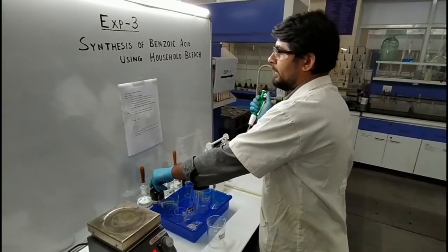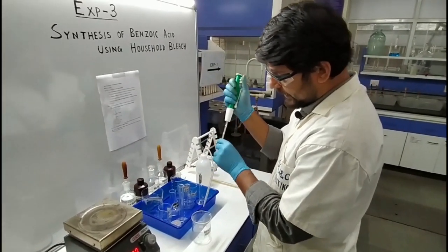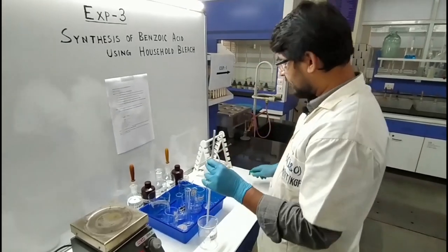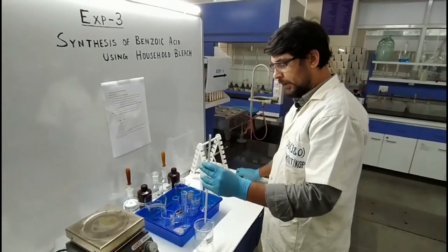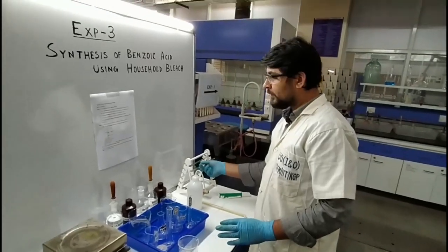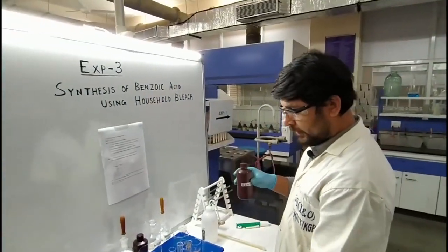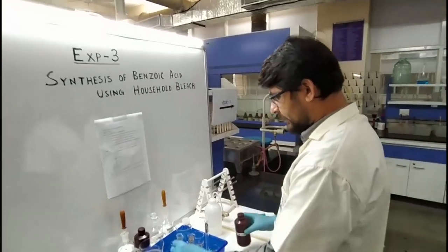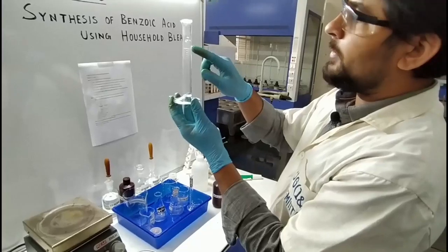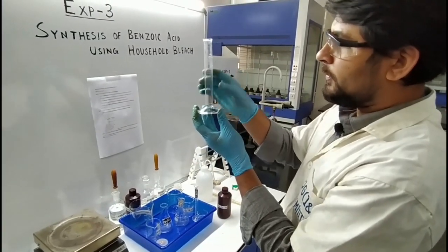Then after that, what do we have to add? 24 ml of household bleach. This household bleach is NaOCl. You can measure this using the measuring cylinder — this one can measure 25 ml. How much is required? 24 ml. So we have to take up to that level.